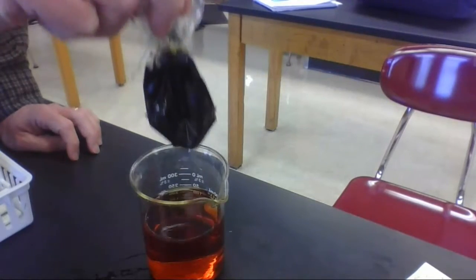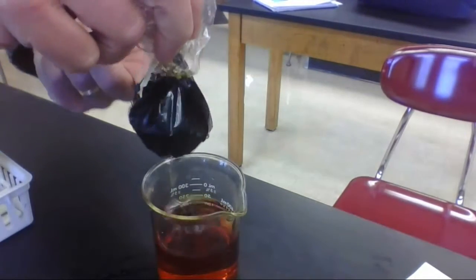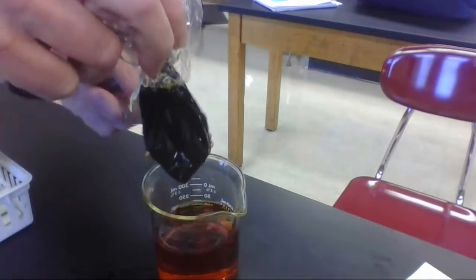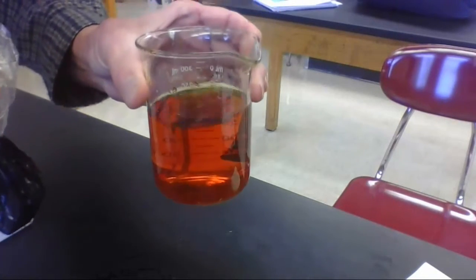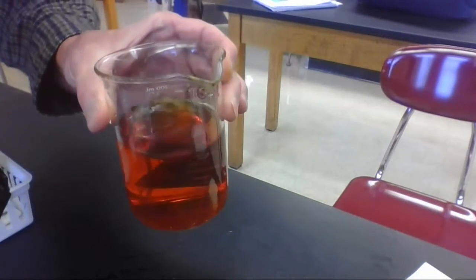So initially, the solution in the bag was white, kind of a starchy white color. Now it's a very dark, kind of blackish color. The solution of iodine looks about the same.